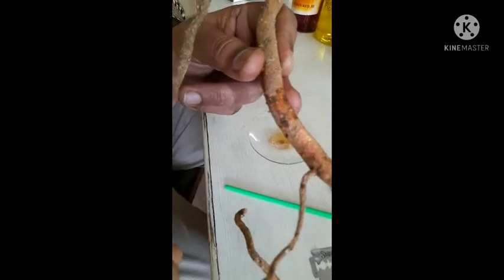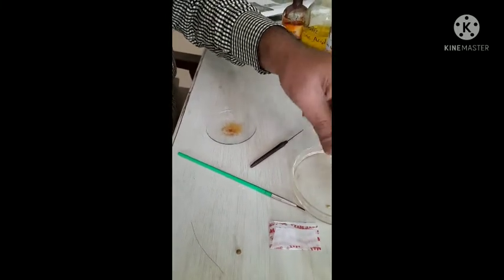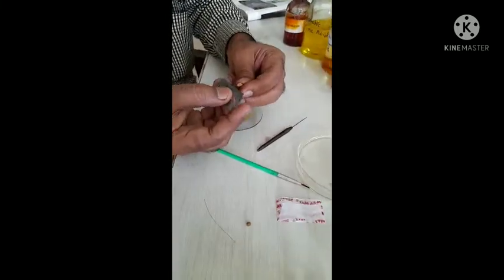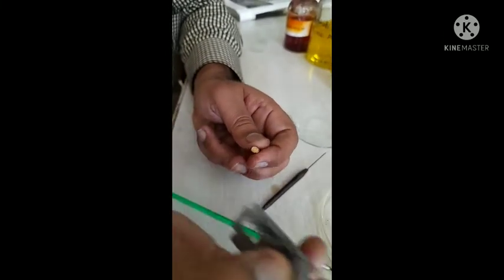So the demonstration of section we start. First, take the root of Ashwagandha — these are the fresh roots of the Ashwagandha plant. Cut the fresh root, or if the roots are dried, boil it for 10 to 20 minutes. Then take it in your left hand and with the help of a sharp razor blade, take a thin transparent transverse section of the root.